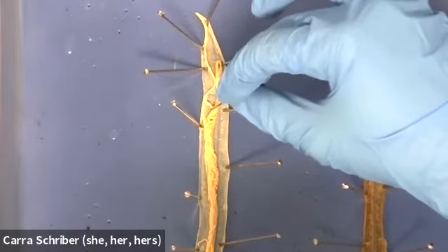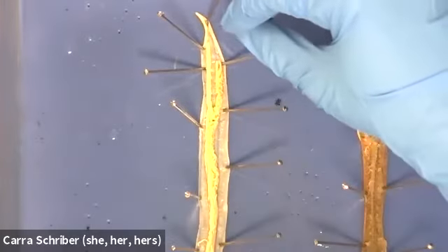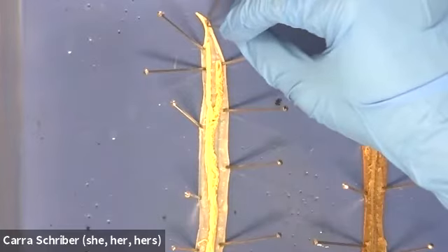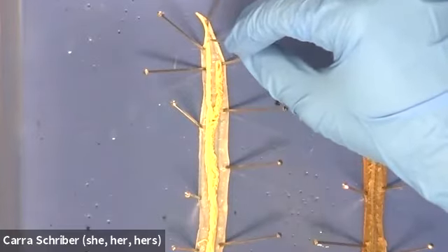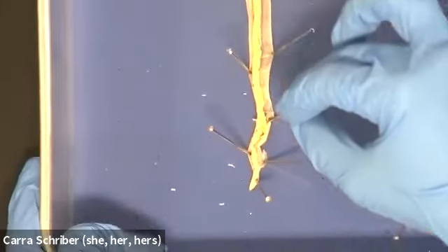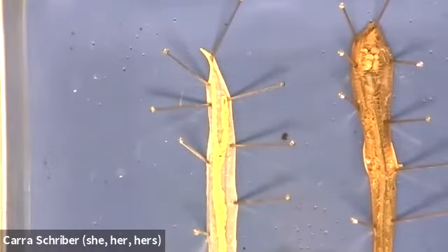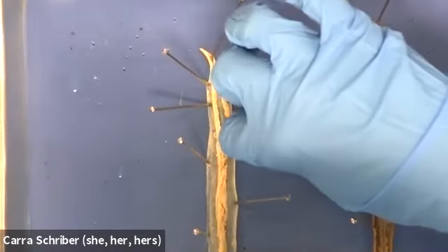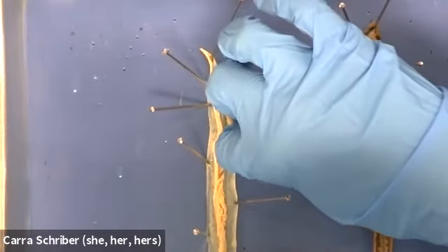That thin ribbon is going to go from the mouth, the esophagus, to the digestive tract, which at this point is the intestine, all the way down the length. So I could follow that thin ribbon all the way down the length of this. The other organs that you're seeing here are all reproductive. So let me try and separate some of this out.